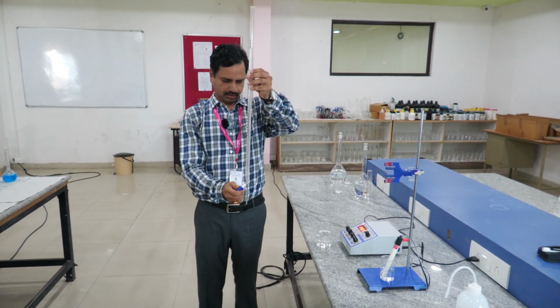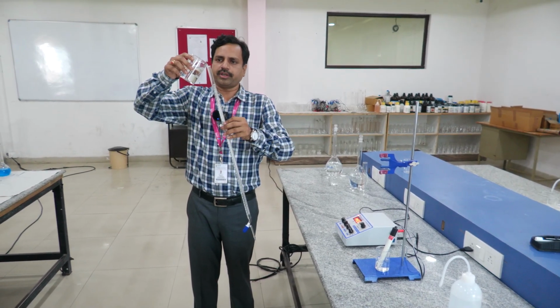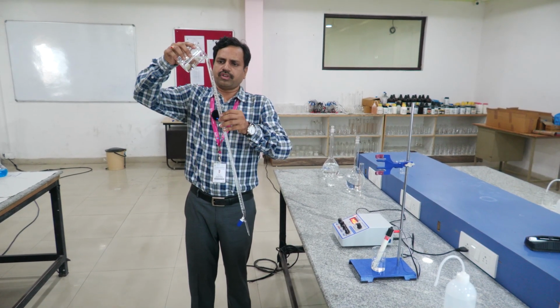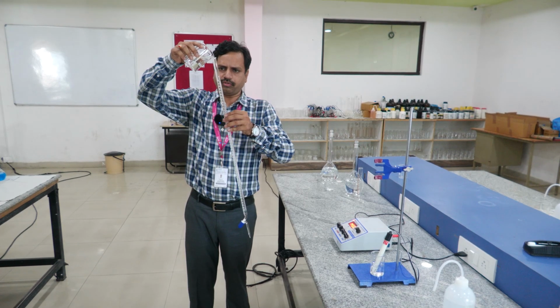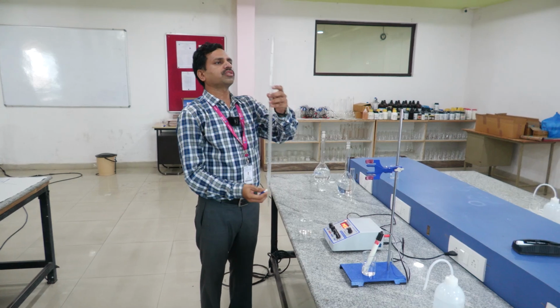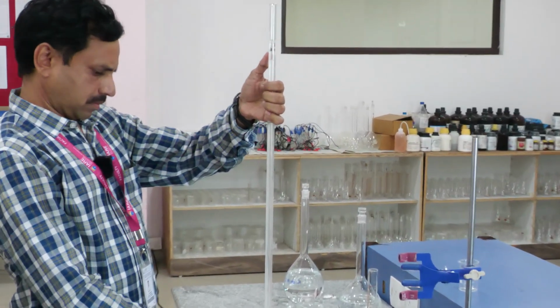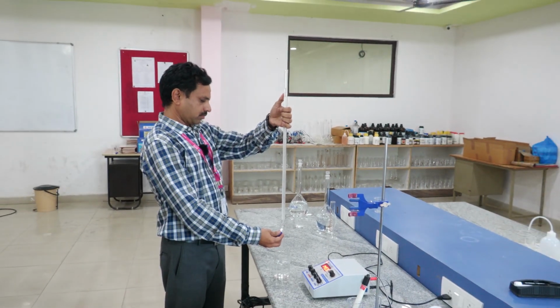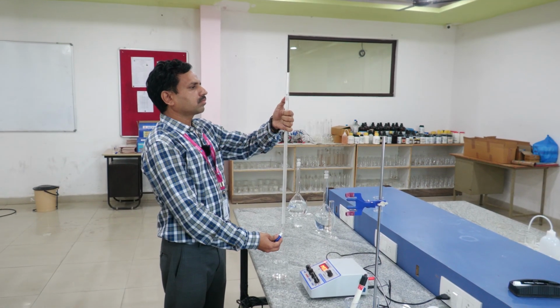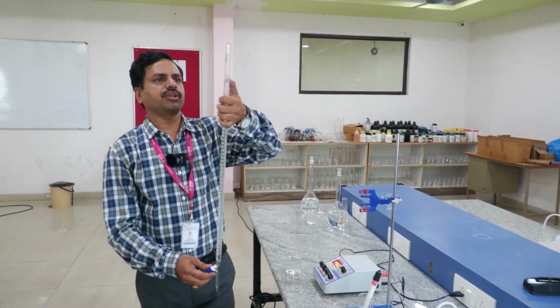We fill it to a little more than 0, and then adjust it to 0. Right, so now it is 0.